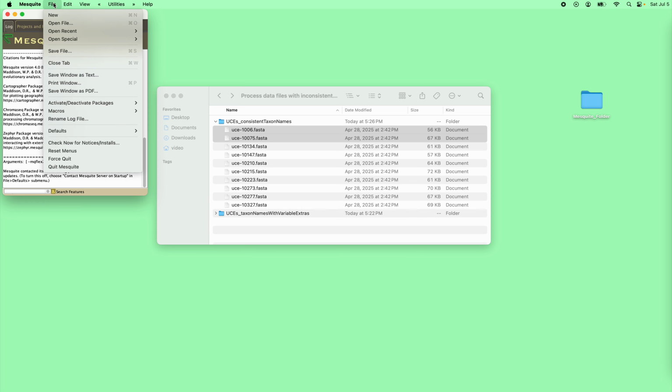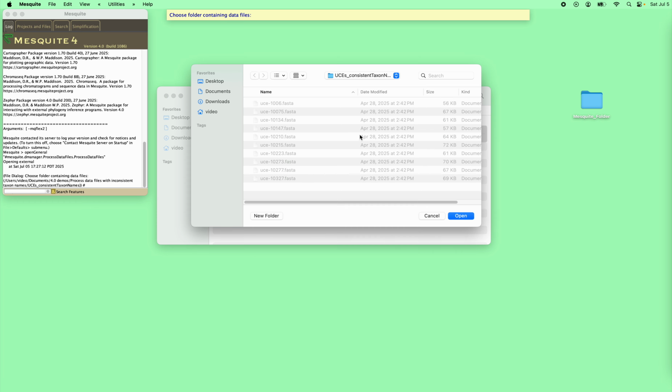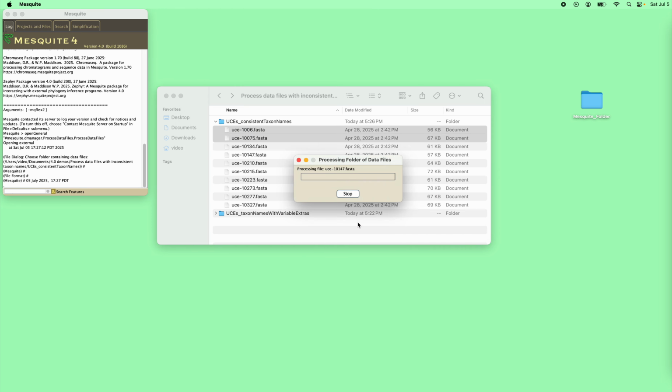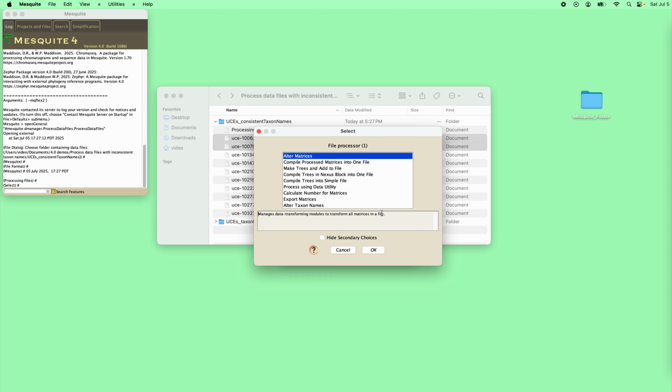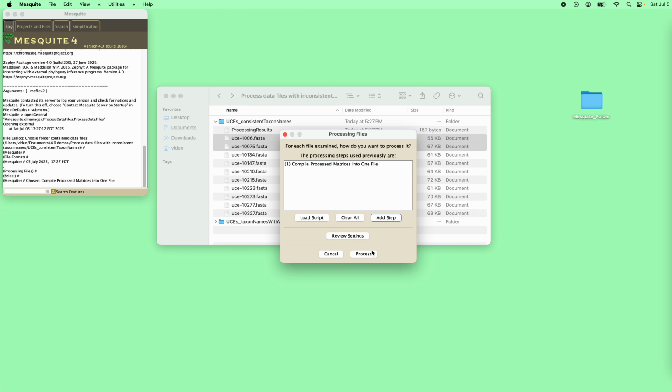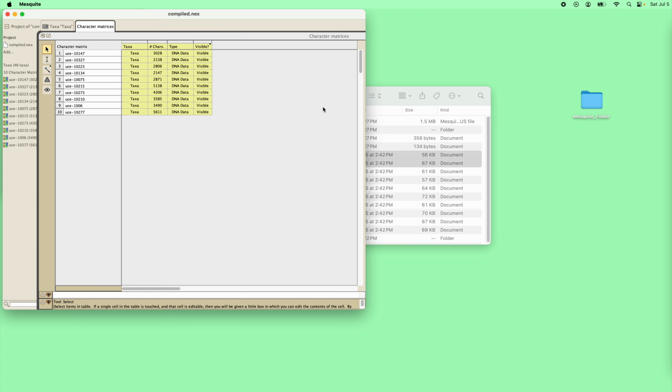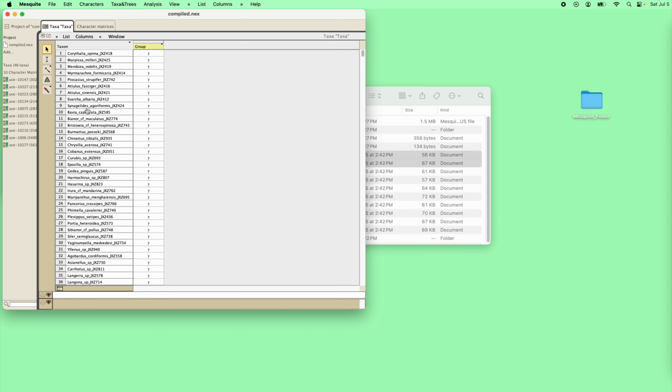We pull them all in and compile them using open special process data files. And here's our directory. We say we want to open it. We tell it they're all FASTA files. And now we have to add the step of compiling. There's a lot of other things we can do, but I'll just show you the simple case. We're just going to compile them all into one matrix. We tell it what the name is. And there you go. Here are the 10 loci coming in, each of them applicable for this set of taxa. So that was pretty straightforward.